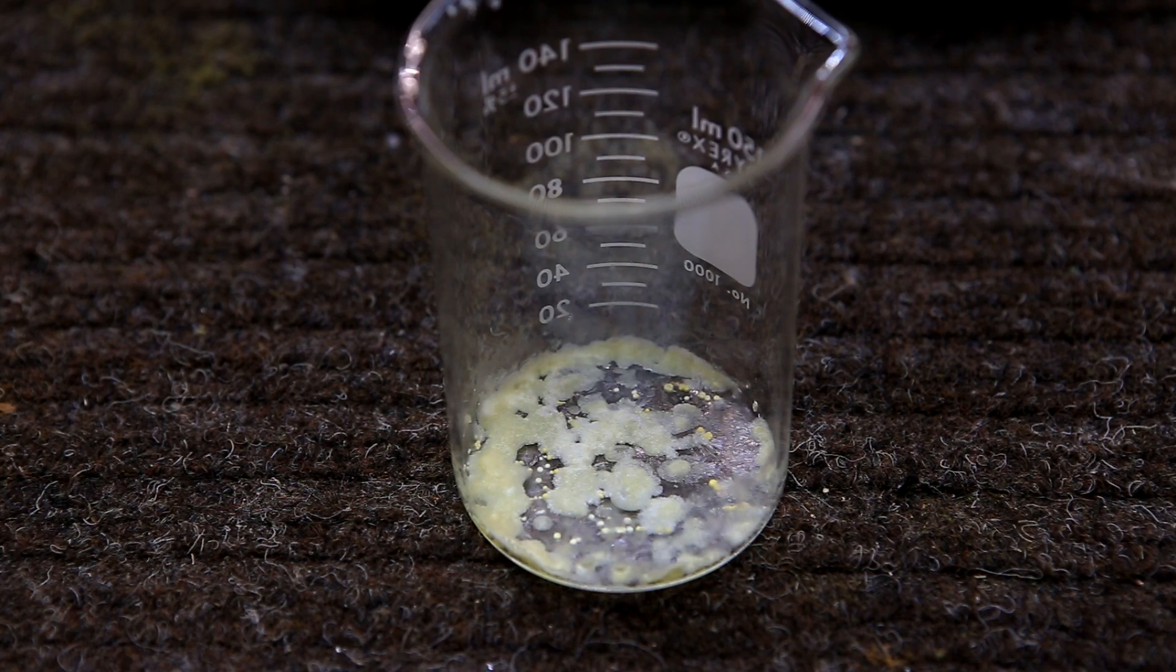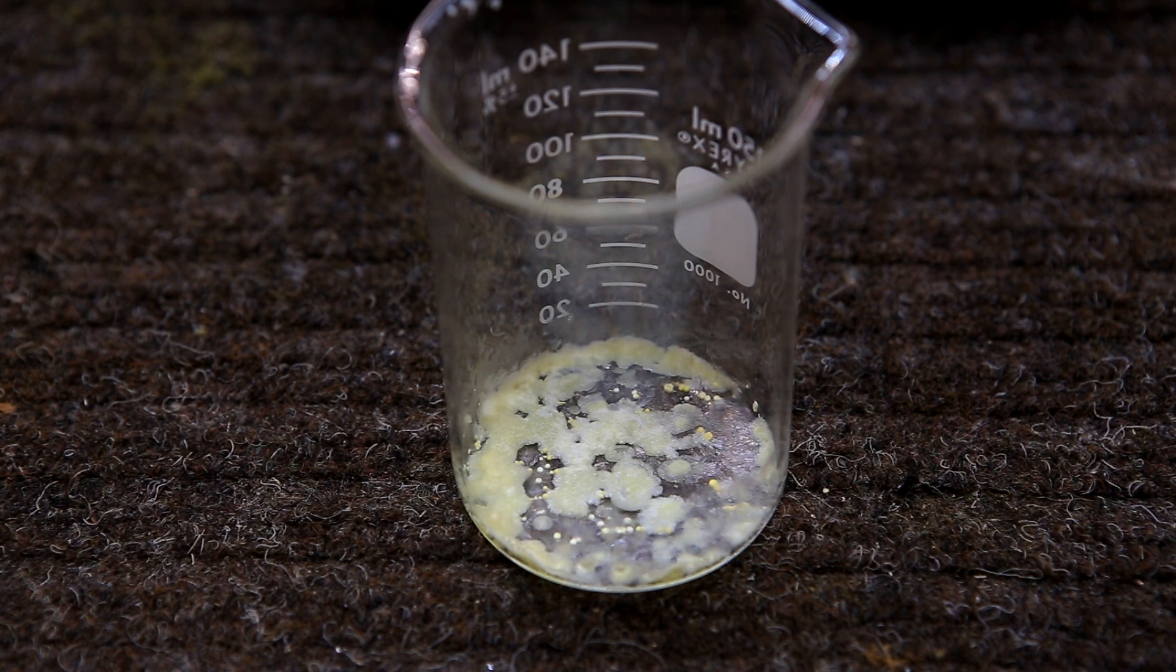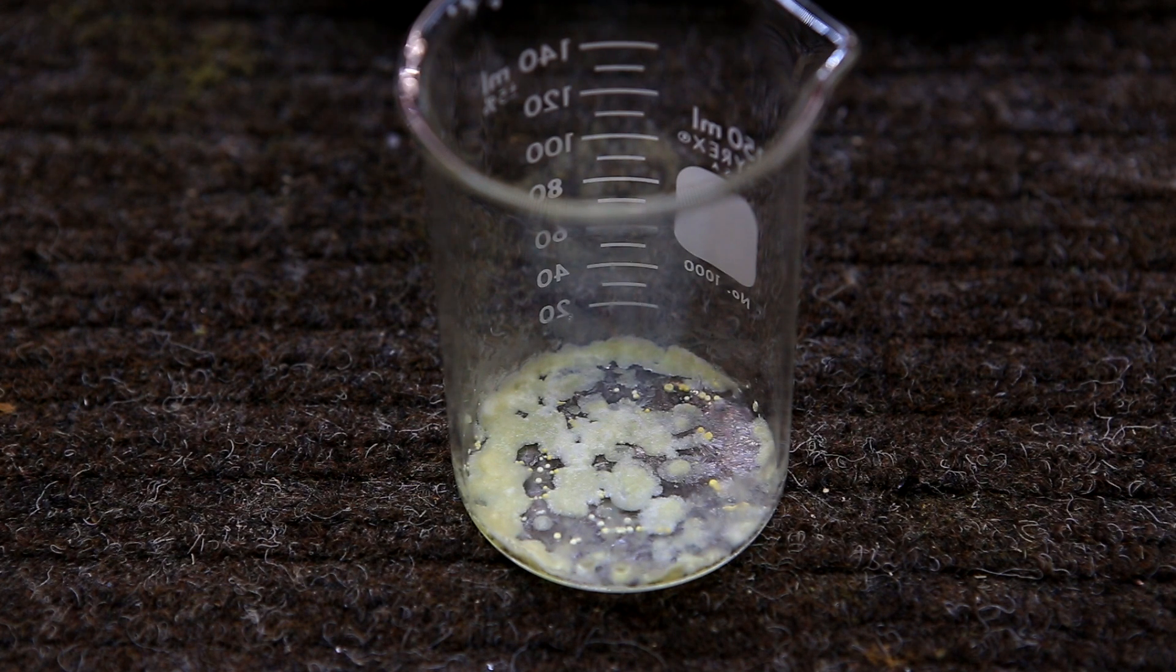The oil is allowed to sit at room temperature and it solidifies into yellow white crystals. This is then recrystallized using water, but it's important to keep the water below 80 degrees Celsius. The melting point of vanillin is around 80°C, and if you try to recrystallize it above this, when it starts to cool oil droplets will precipitate out instead of crystals.